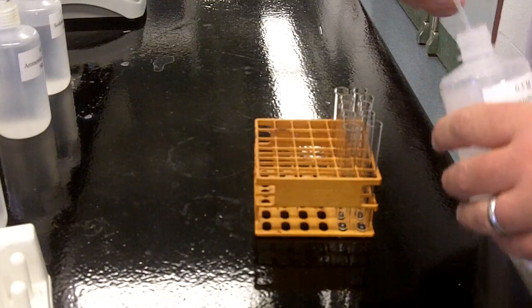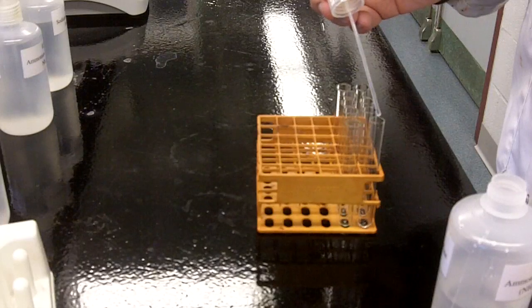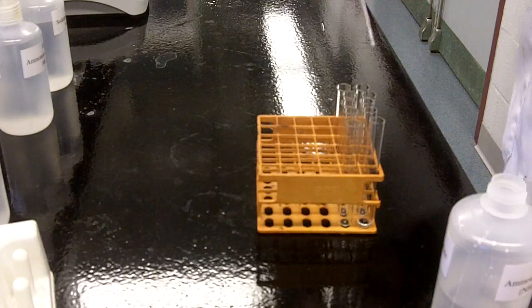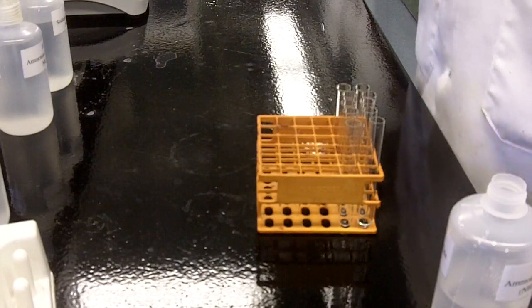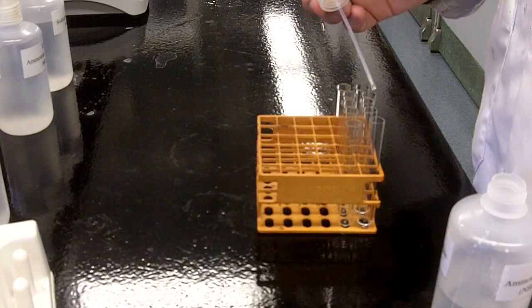In terms of execution, we're going to give you these special racks. Each person has 12 test tubes, so between the two of you, you can set up the grid in your rack and then it's basically just follow the procedures. Four drops of each one.